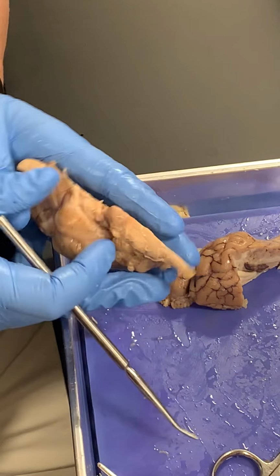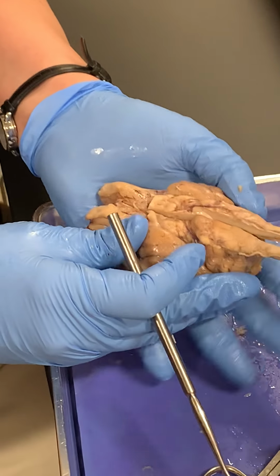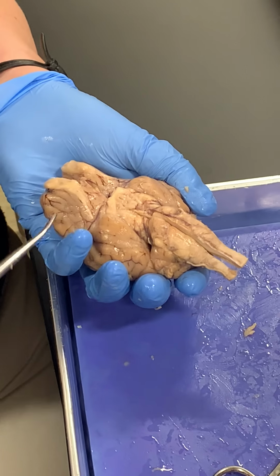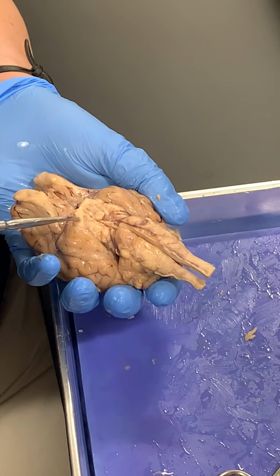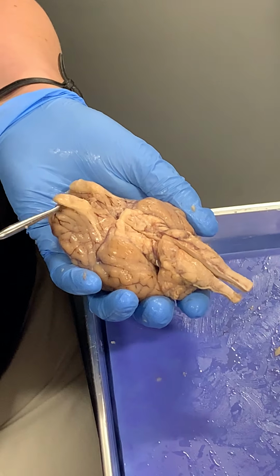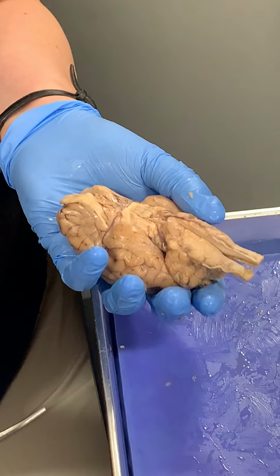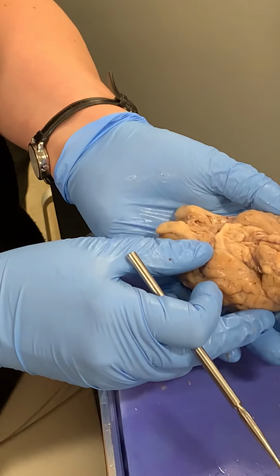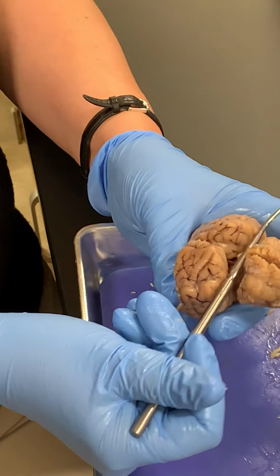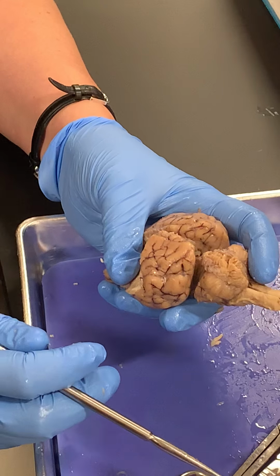Okay? So I want to put them together so that you can see the optic chiasm, at least what remains of it. This is the optic chiasm. I had to cut through it. This is the optic tract. This is the olfactory bulb, but it's just fine if you say olfactory nerve or cranial nerve 1. That's fine. Did I miss anything on the surfaces? Oh, transverse fissure exists between the cerebellum and the cerebrum. Now I think we got it all.